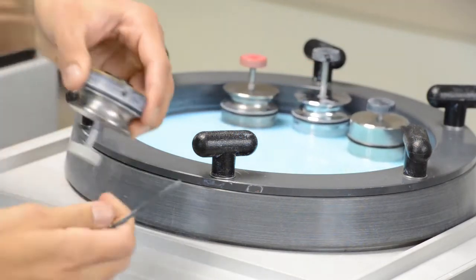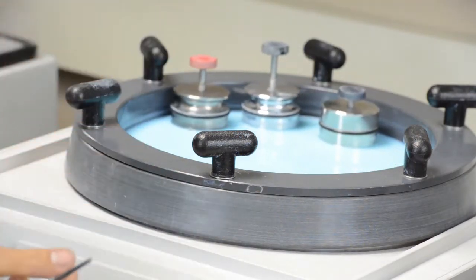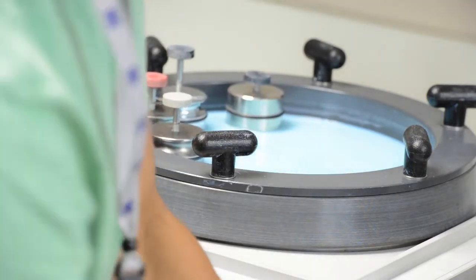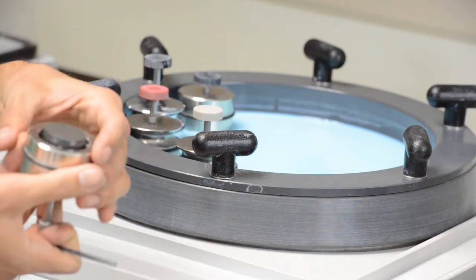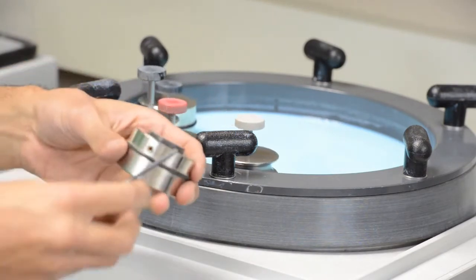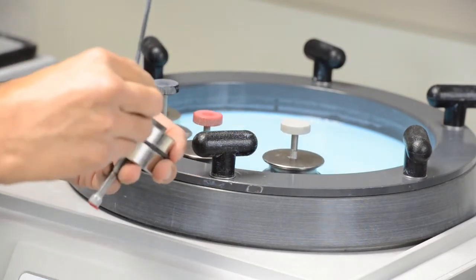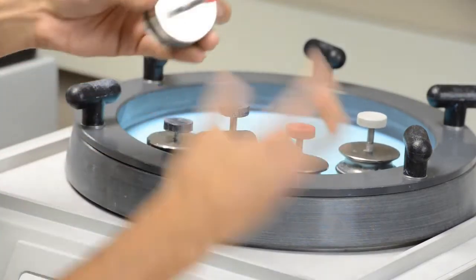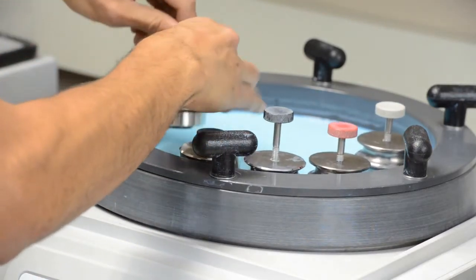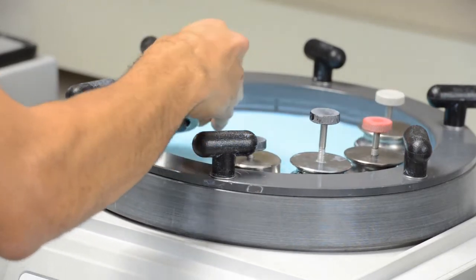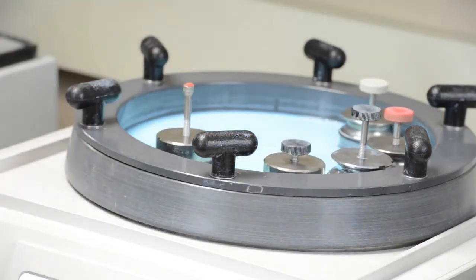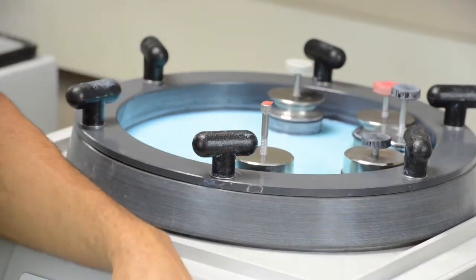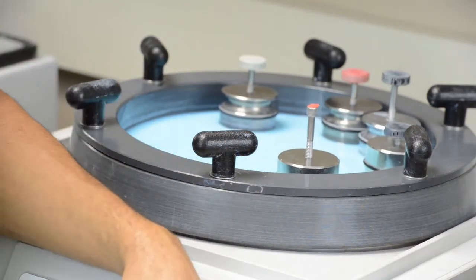So here goes the aluminum block. There's my aluminum block. And I'll just put it right there. And finally, this last guy. Got it. And now I can leave this here for 24 hours. And the samples will look a lot better. So let's wait 24 hours and see what they look like.